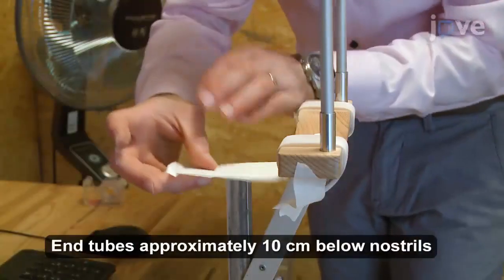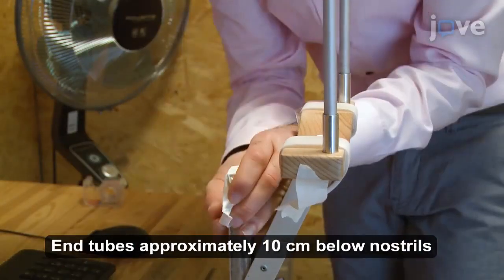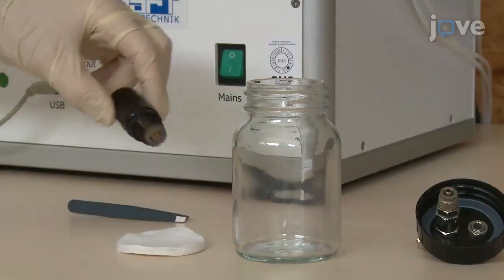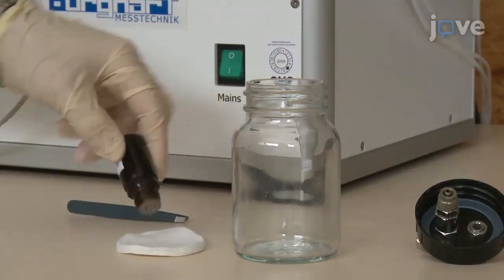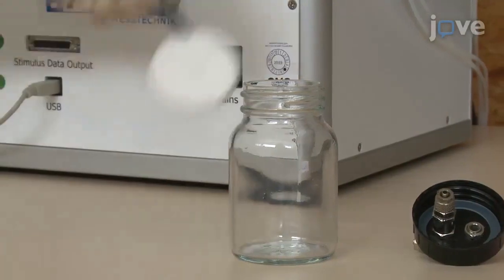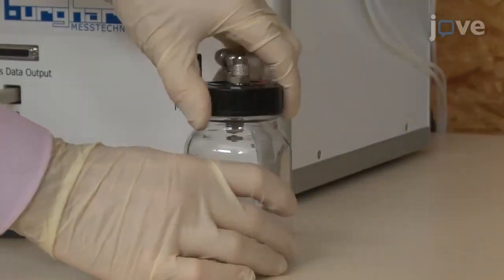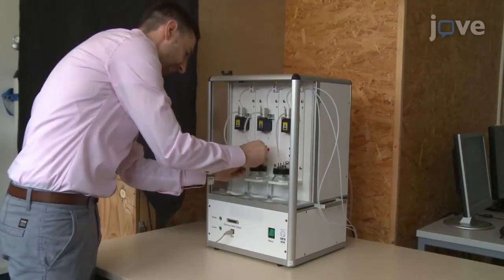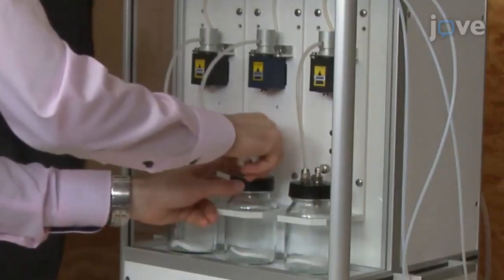Then, cover the top of the metal bar with tissue. Then, apply the appropriate amount of liquid odorant onto a cotton pad and place that cotton pad within a glass jar. After that, connect the jar to the olfactometer.